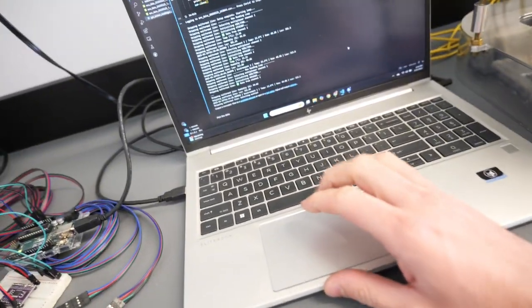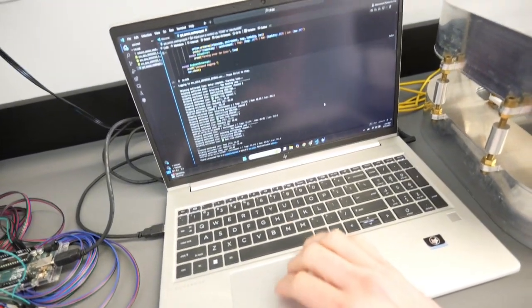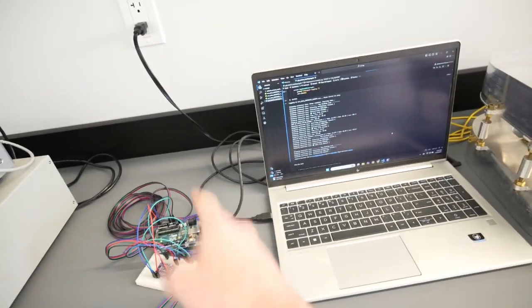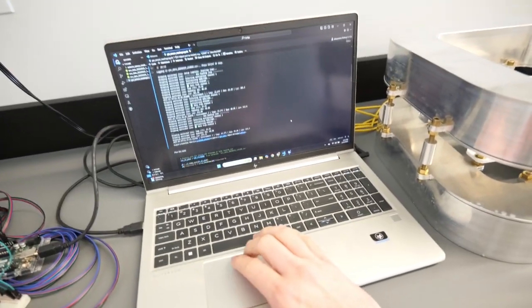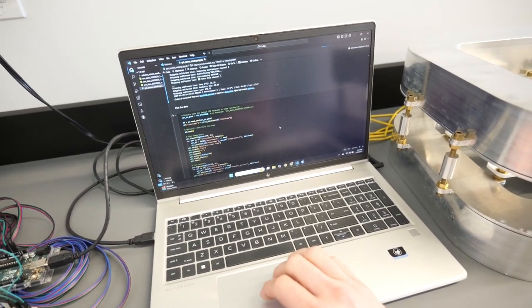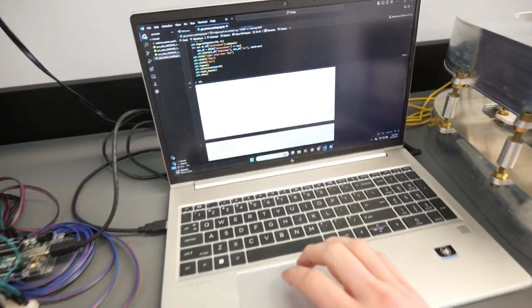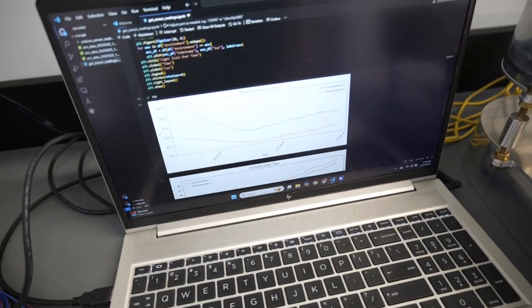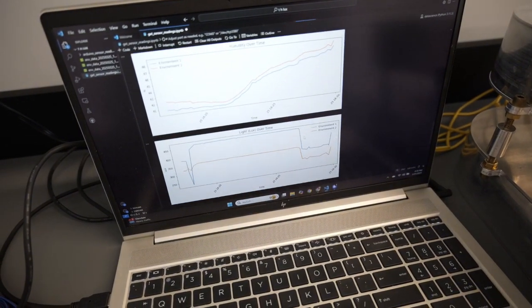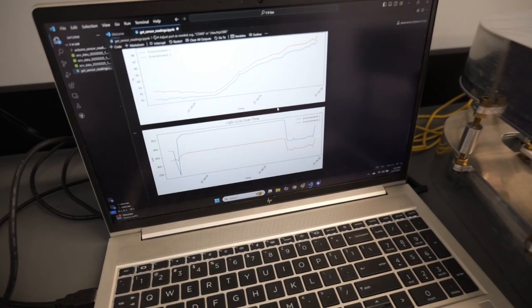And you see I have here the code. It's a Python code that is reading through serial connection the values that are read by the Arduino. And so yeah, basically this guy is getting data every 10 seconds. And here you can see it's basically plotting the temperature over time, the humidity, and the light. And those are the two different environments.